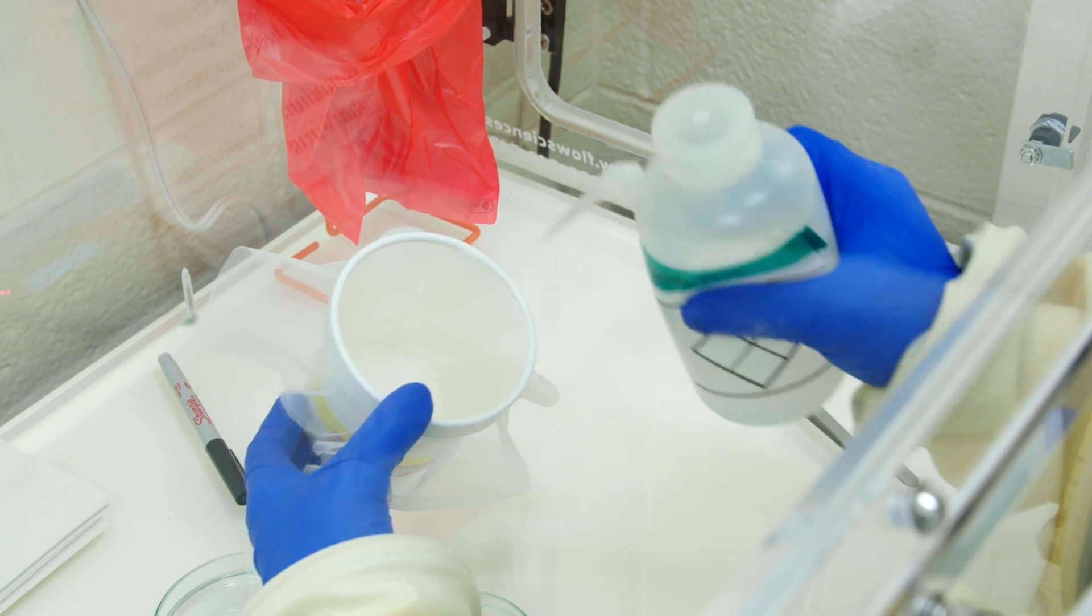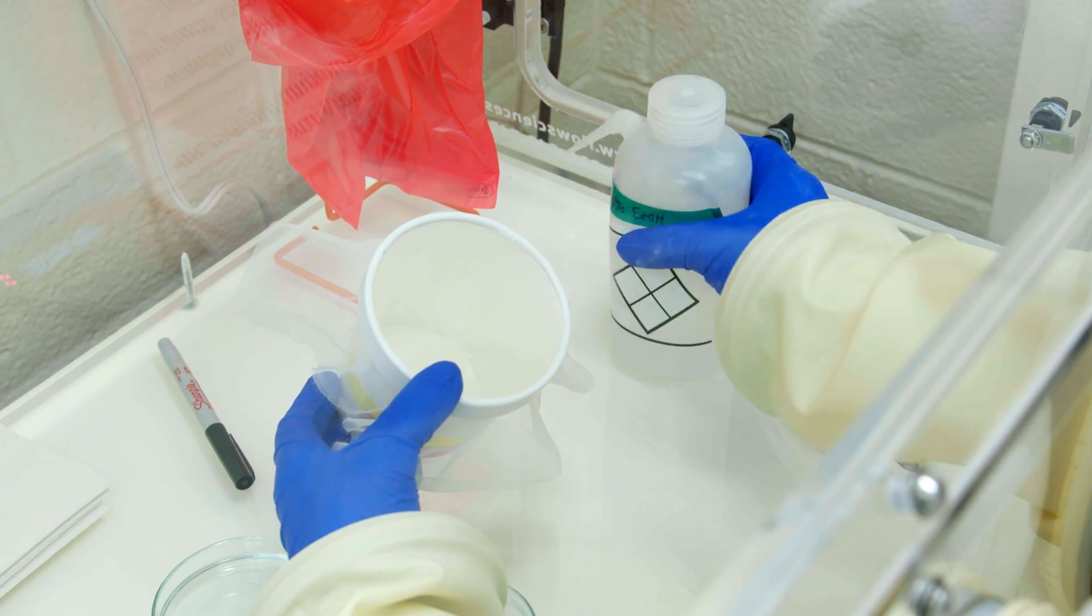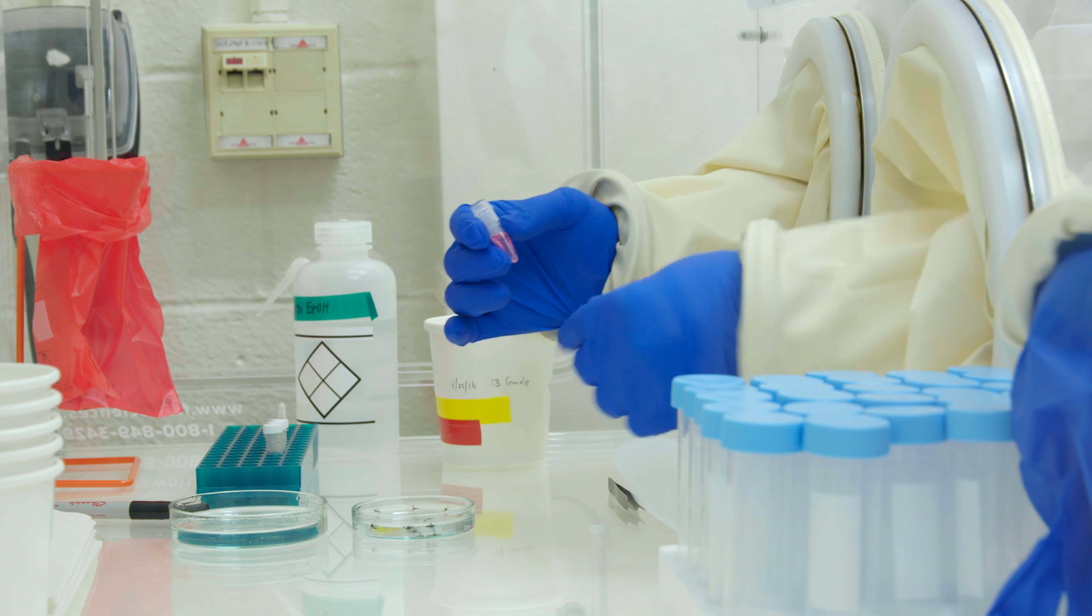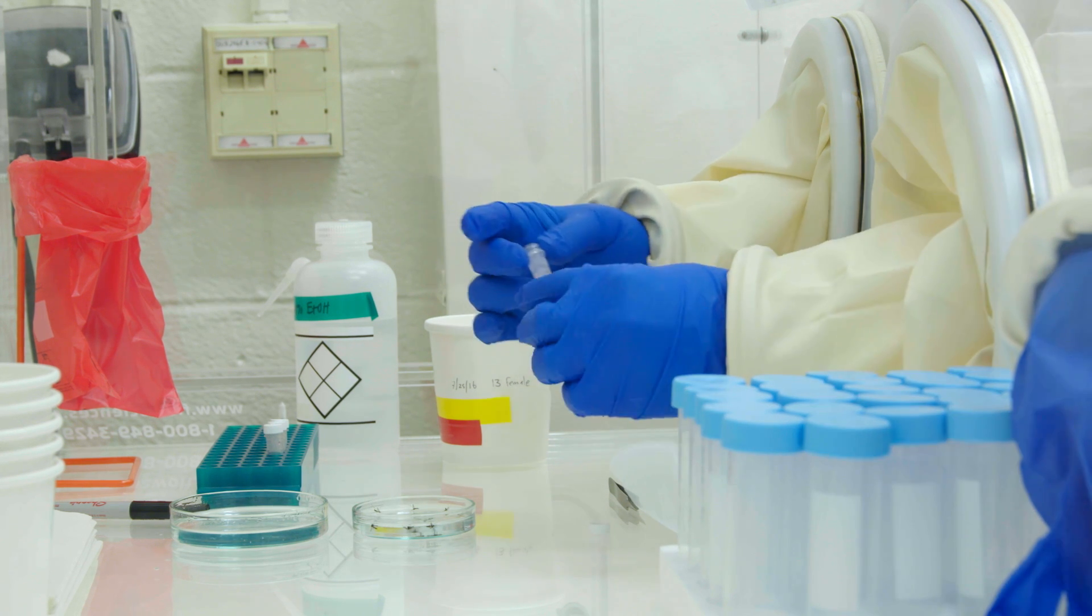I have mosquitoes in buffer. They've been washed and I'm going to collect them into this buffer to extract their RNA to look at their gene expression.